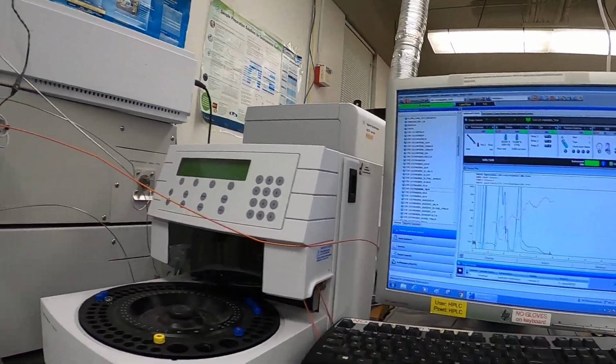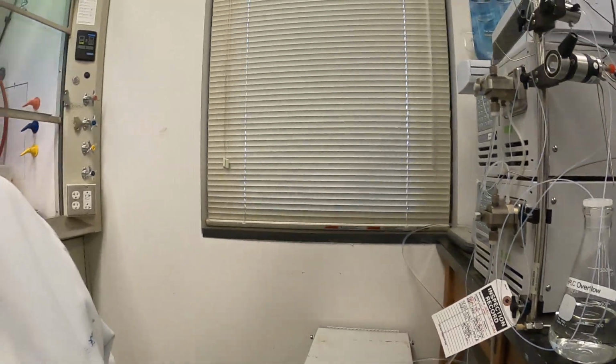The one thing that's important though is when we're done with it at the end of the day, I've got to make sure you guys stop the pump so it stops pumping. My staff wasn't so good last quarter, and there was a couple times where it ran all night, so we really went through the methanol last quarter, and that's not good. We want to keep the fees down and make sure that's shut off, so it's best if everybody checks on it.